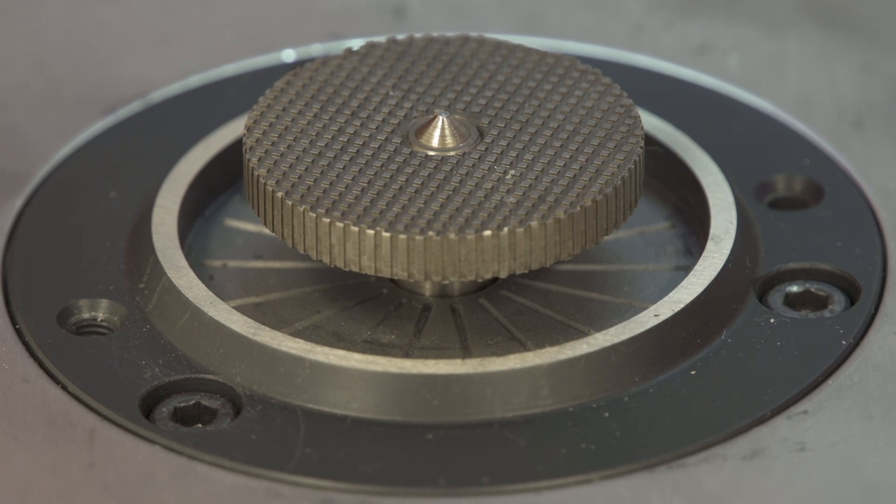Balancing is completed and the instrument is ready for testing again.